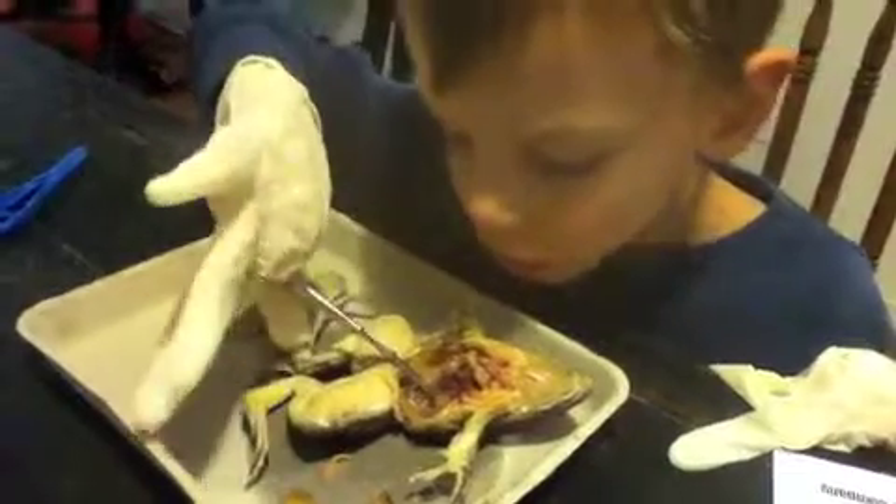Did you tell dad what the frog's name was? Rib. Or Rim. Which one? Oh, it's got poop in there. Oh. Gross. It's okay, Harry. That's what's supposed to happen. That frog has been torn up. Wow, Harry.